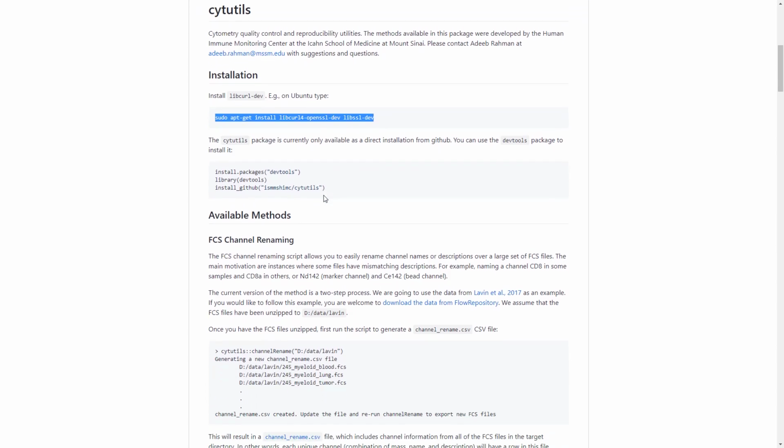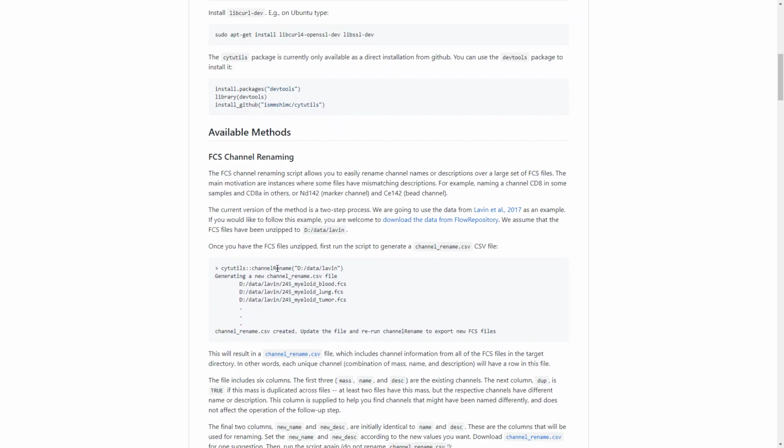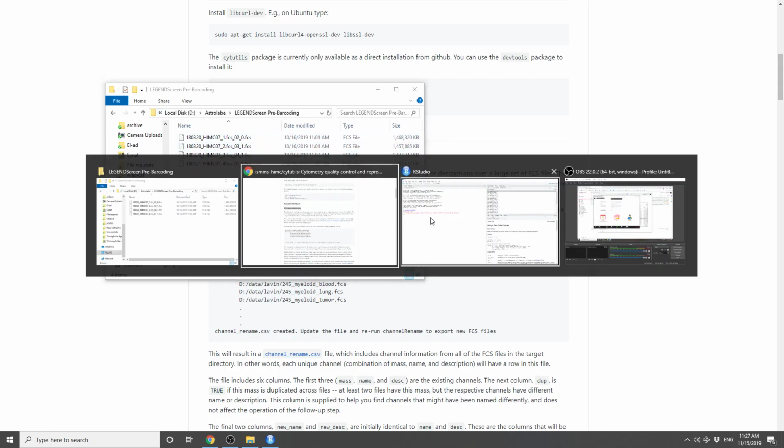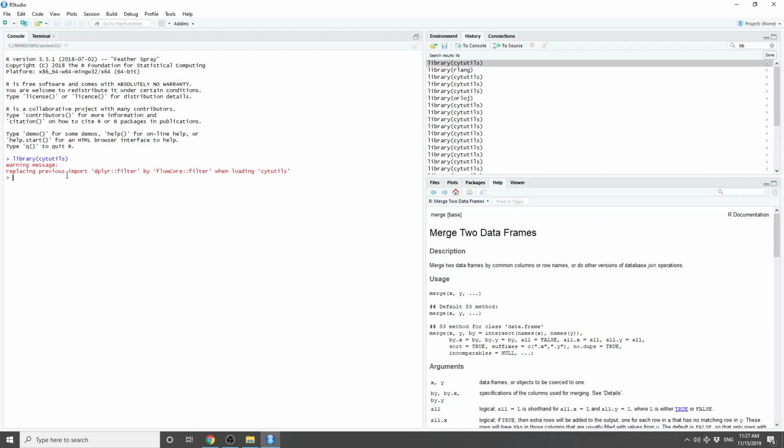And within cytutils, there is a function called channel rename, which allows you to rename FCS channels pretty easily. So let me show you how that works. We have 4 FCS files that we would like to rename, and I'm going to go into R, and I already loaded the library, and now I can call cytutils channel rename and supply the directory where the files exist. So here is the directory.